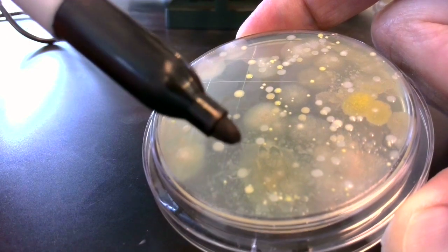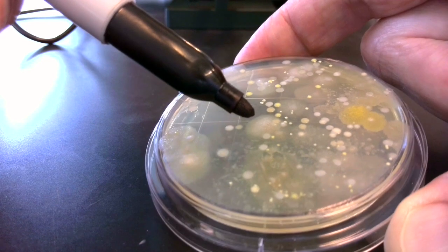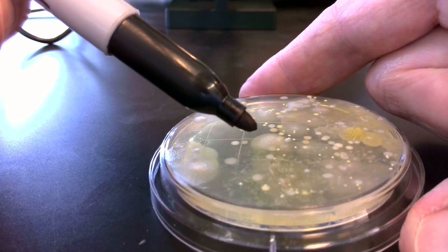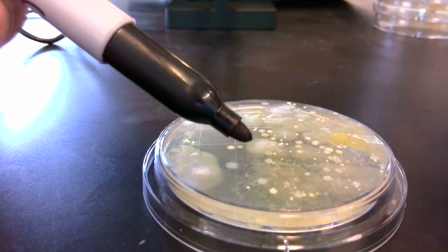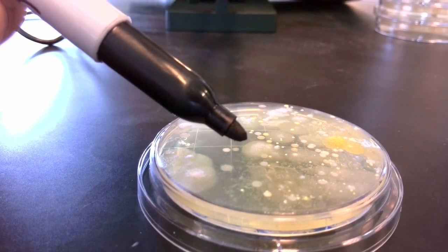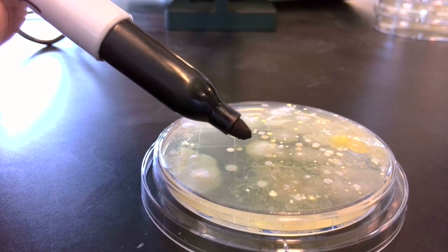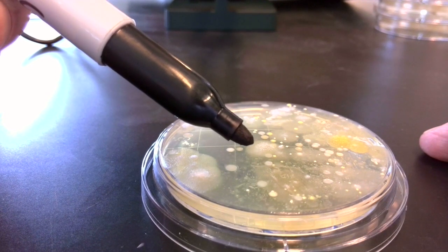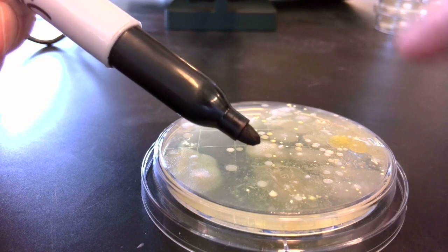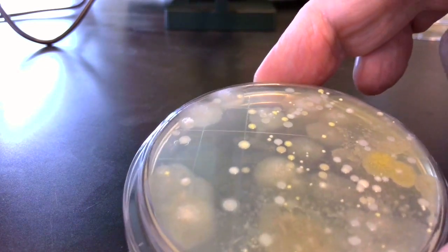In contrast to that, I want you to look at this one right here now. So notice that one. If I turn the plate a little bit, we can see that that one is protruding out from the surface. And more interesting than that, if I focus the camera there, you can see that there's these little white balls even there. Well, this one, if you look close at that, what's growing there, it's a little bit fuzzy.